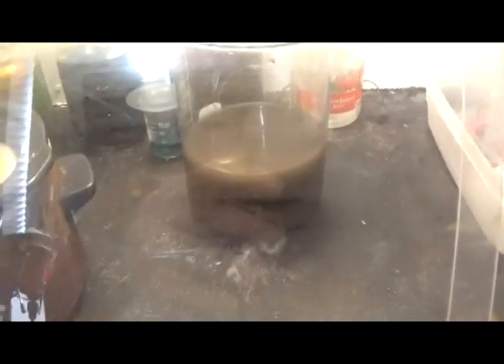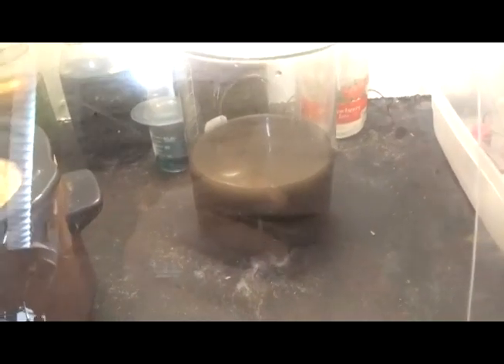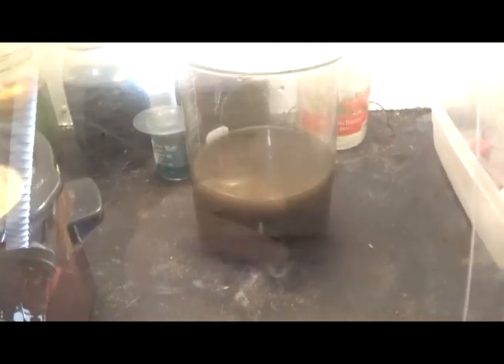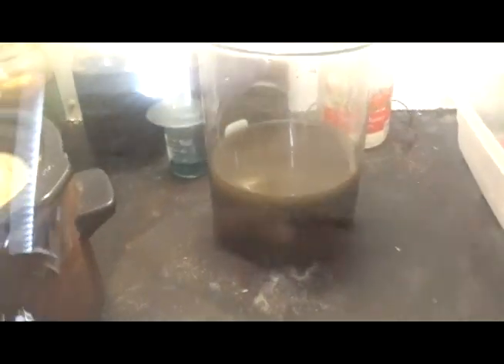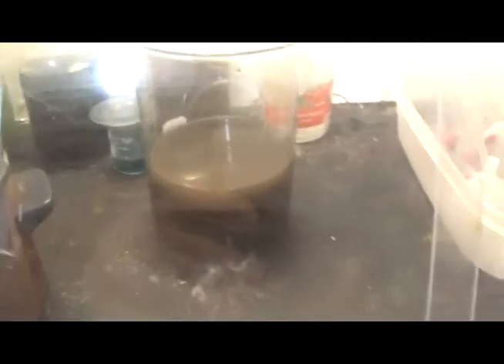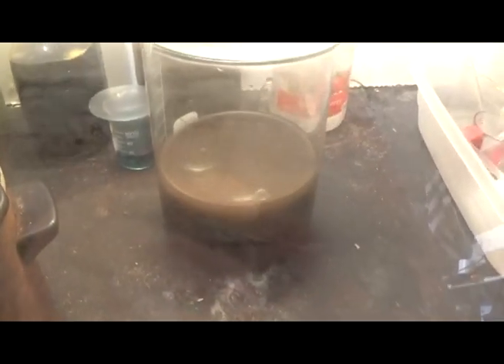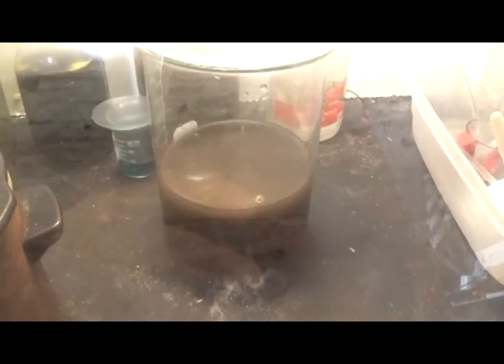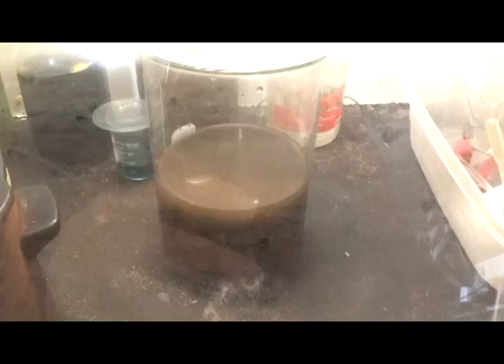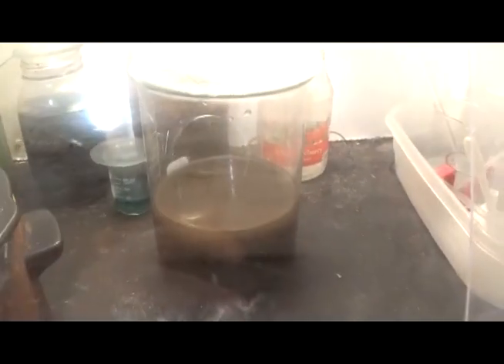One whiff. I put 3 big teaspoons of SMB in this. That should be enough. It might require another. We'll do a stannous check here in a minute. I just hope that isn't super fine. Ugh. What do they call that stuff in Africa? That stinking talcum powder type fish sand. Yeah, I hope it ain't fish. But anyways, we'll be back.